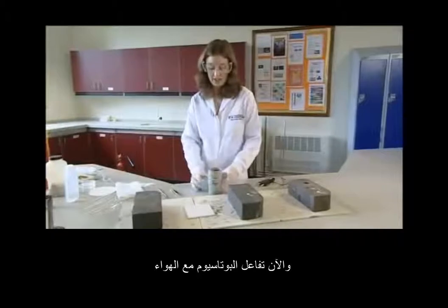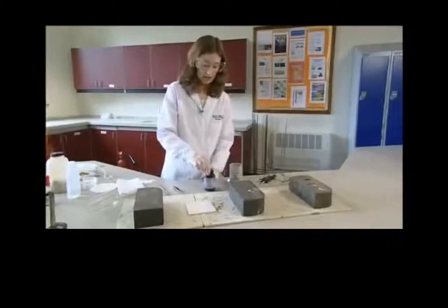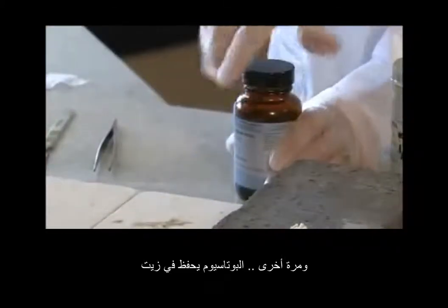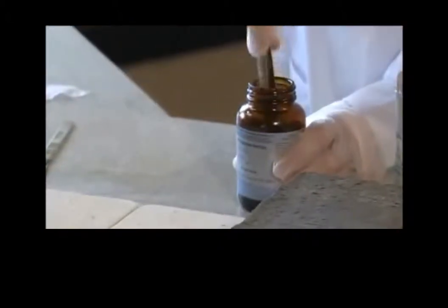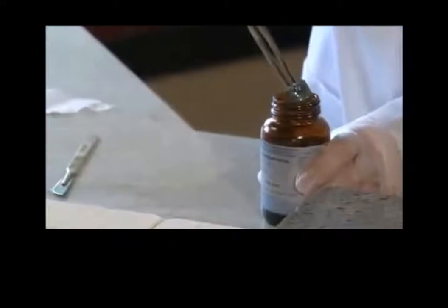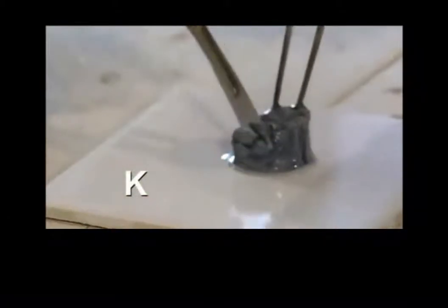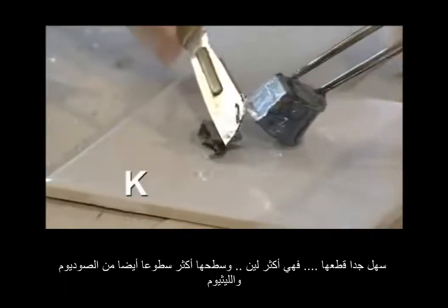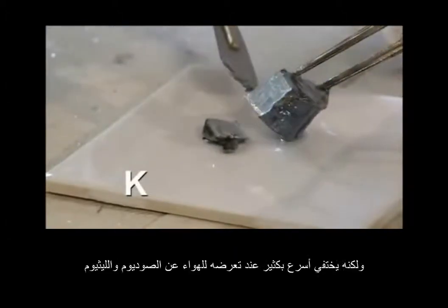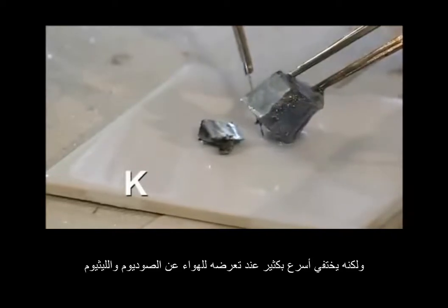This is a reaction of potassium in air. Again, the potassium is stored under oil. And we need to cut a piece off. You can see it's much easier to cut. This is much softer, and there's a shiny silver surface which tarnishes quickly in air, much quicker than with lithium and the sodium.